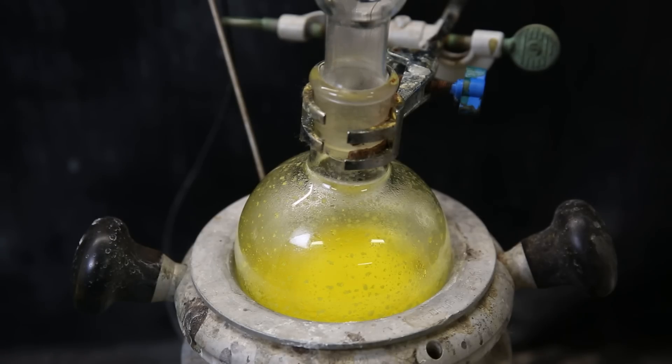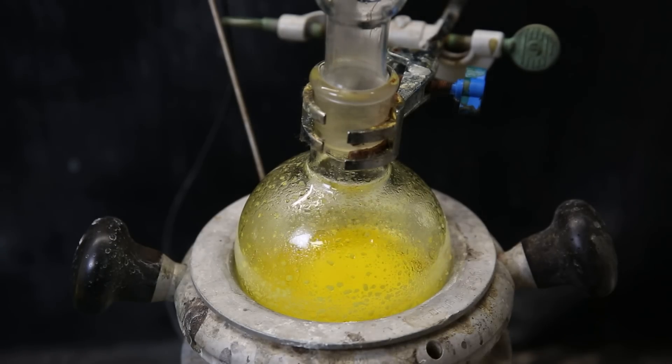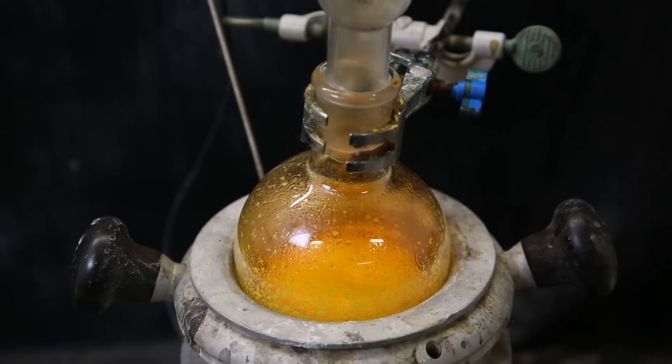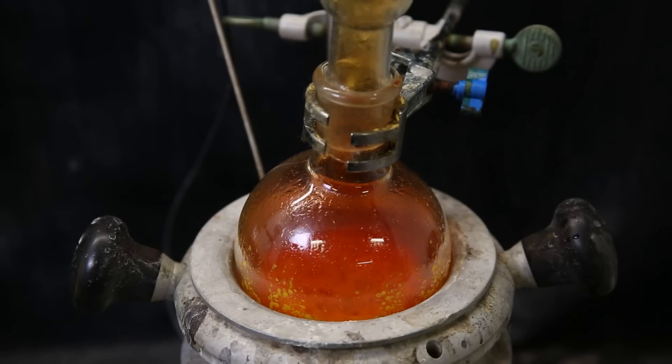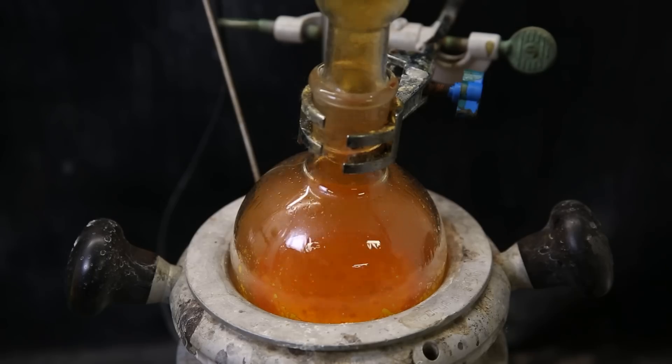As it heats, the reaction gradually starts, and first dark red nitrogen dioxide starts coming off the mixture. The hexachloropropene starts to boil, and the reaction continues relatively calmly, even though it looks like a miniature of hell. I just leave it heating like this overnight.